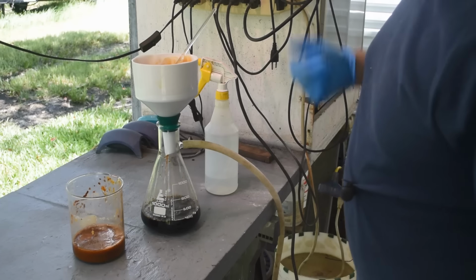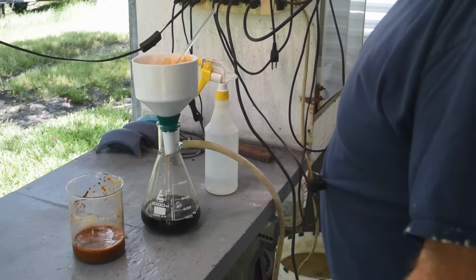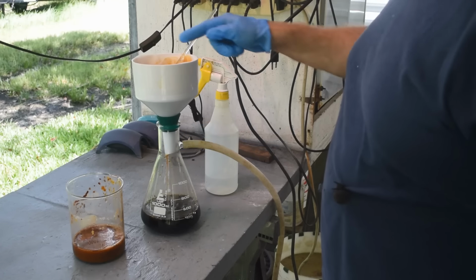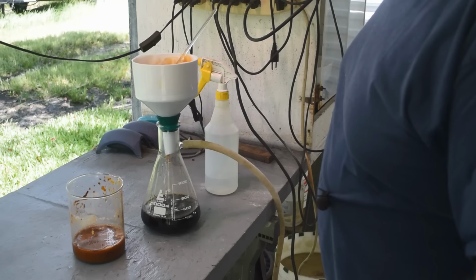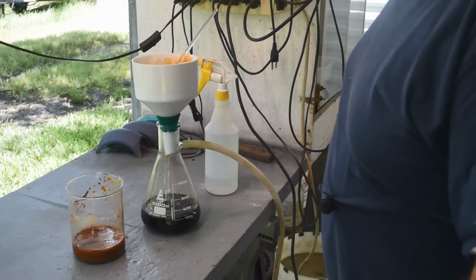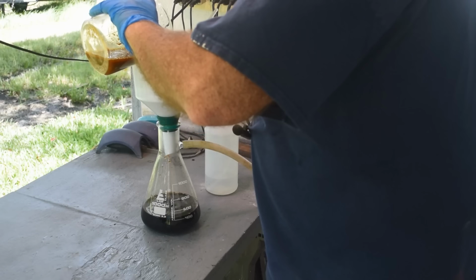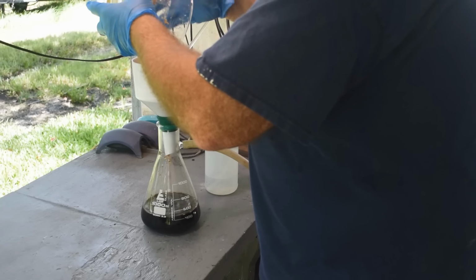No, it's slowing down. I guess that first batch just came through quick, but now the pores in the filter are getting clogged up and it's slowing down. So it's going to take me a while probably to get the rest of this stuff through, and I'm going to have to wash as much of the red color out of the filter up here as I can. So I will keep the filter and throw it with my rag and filter storage for processing sometime in the future. Yeah, it's just gotten slower. I guess it just came through fast at first. Now it's really going to slow down because the bulk of the paper pulp just went in.